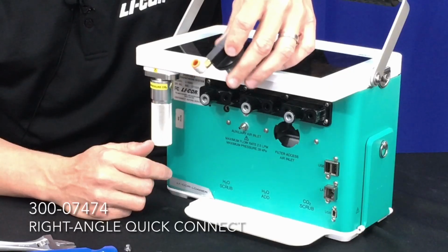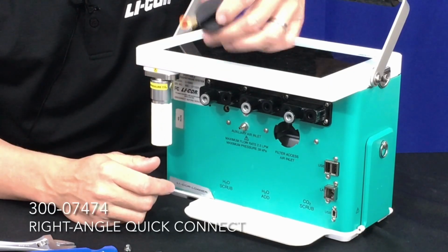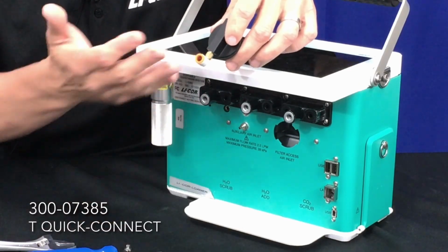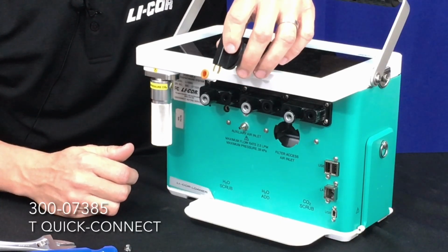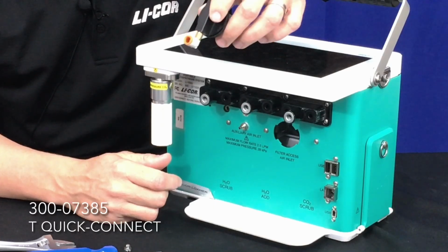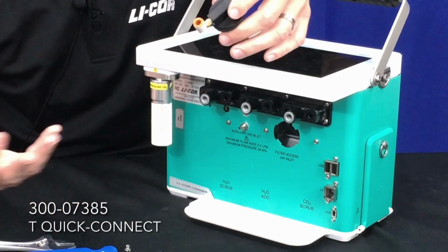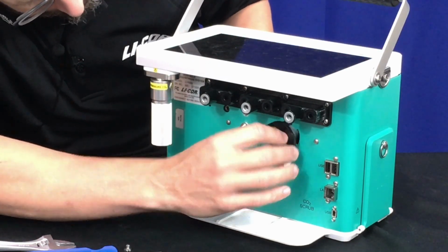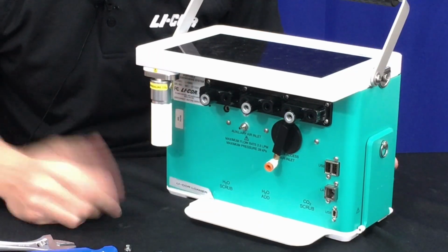So the caveat in this case is to ensure that the flow you supply is greater than what the 6800 console pump requires, so that all of the air is coming from your controlled source. If that flow rate from your supply drops below what the 6800 pump pulls in, then you'll be pulling in ambient air as well, and it will cause error in your measurements. So in either case, that's about all you need to change for the plumbing, and you'll be ready to go.